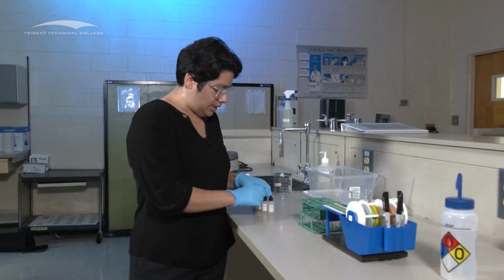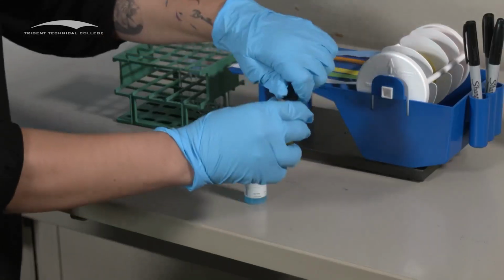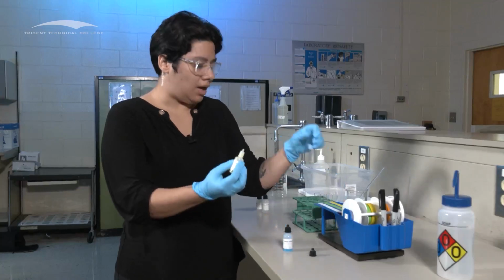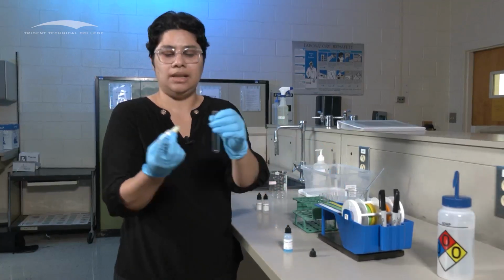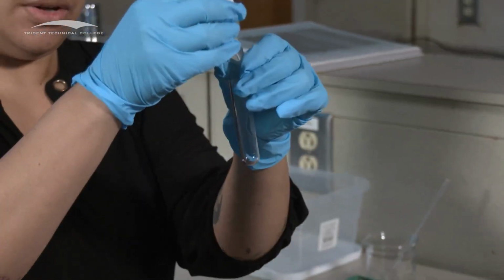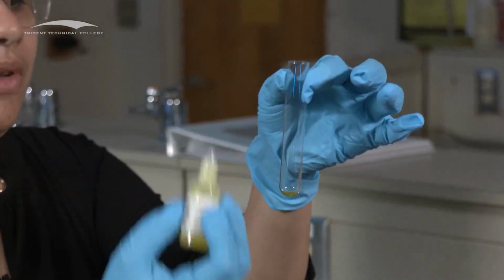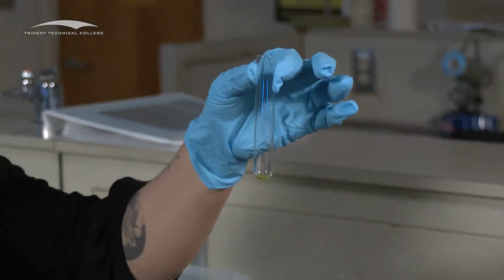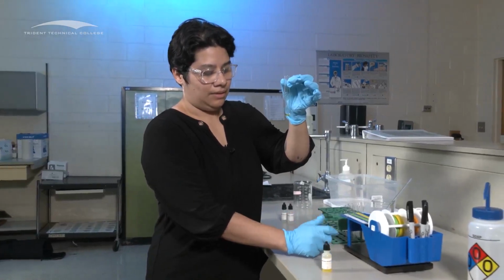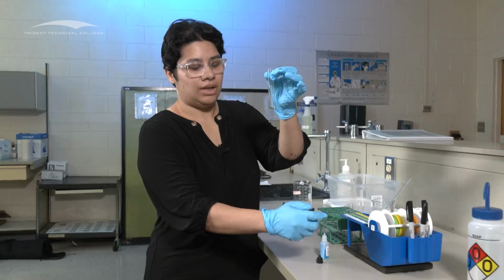And then to do this, it's really easy. Just find the reaction that you are doing. And then you're going to open what you need. And then you're going to put 2 to 3 drops. If you need a couple more drops, I'm going to use an unlabeled one. So make sure that you read thoroughly which one you're putting in. So you're going to put 2 to 3 drops of it. And if you put a little bit more, like 1 ml, that's okay. And then ideally, what you should see is a precipitate. And please make sure you cap everything once you are done using it.